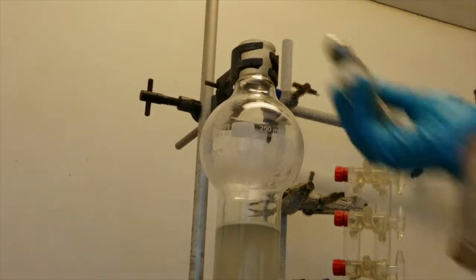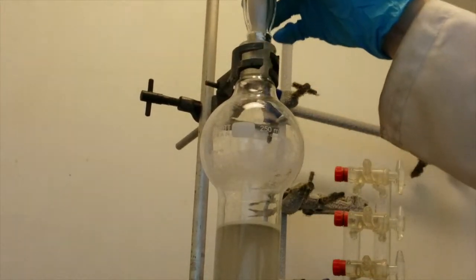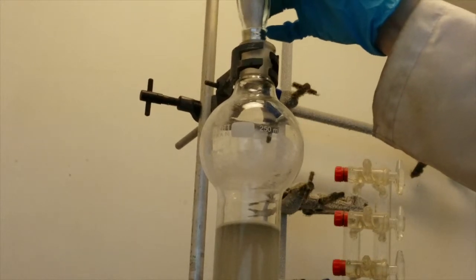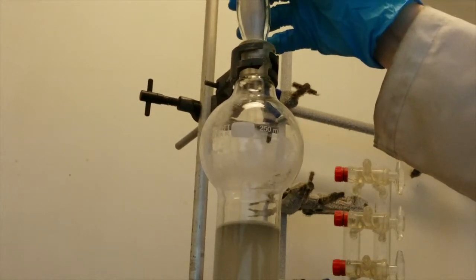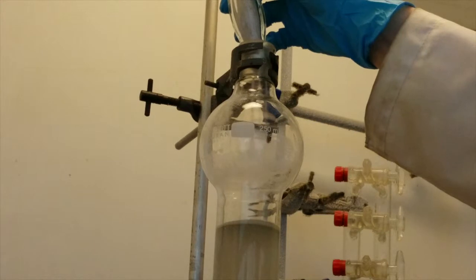Working as quickly as possible add a layer of sand on top of the silica. You'll need a minimum of a centimetre but you can use more if you find this helpful. Use a sand shaker to transfer the sand if you can't do it directly from the tub.